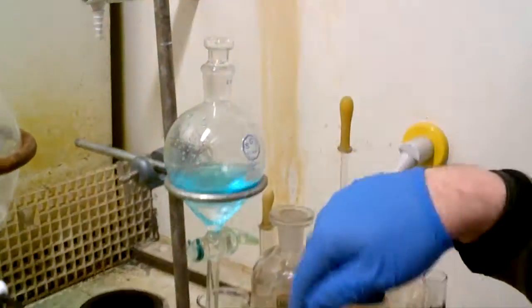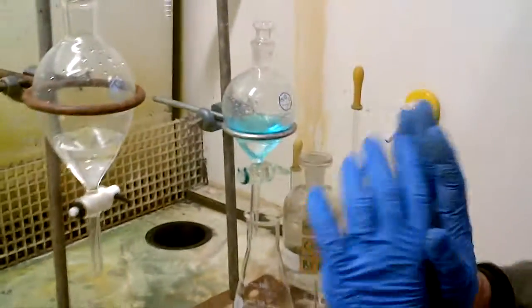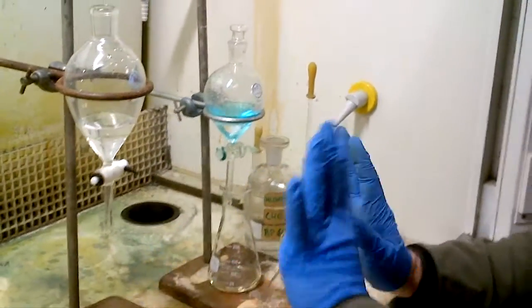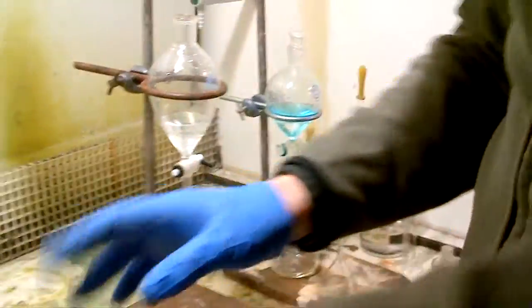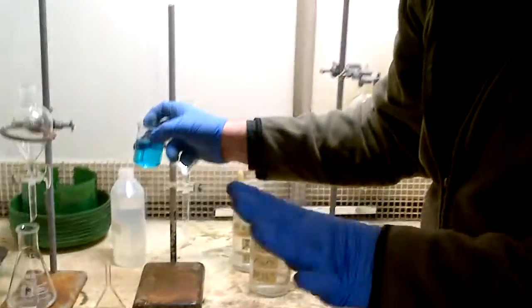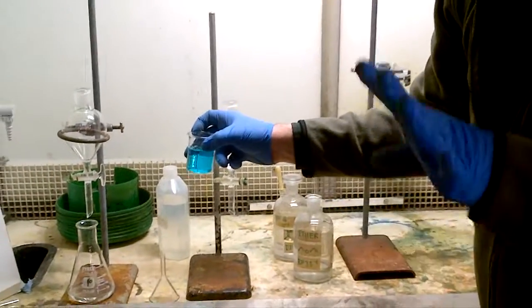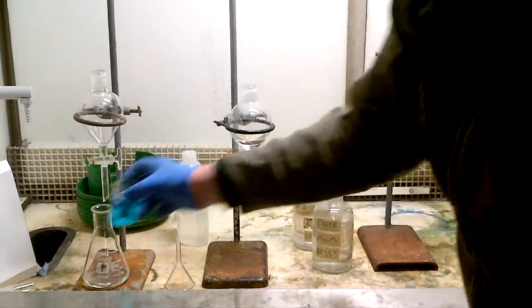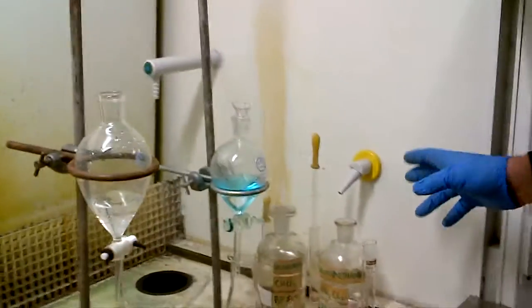And you can feed the DCM into here, when you're doing any reaction, DCM, chloroform, ethyl acetate, ether, never throw away the aqueous phase until you're entirely happy you've recovered the product, right at the end of the product, keep aqueous phases, so keep it at that point, keep the aqueous phase and put it into a beaker, don't throw it away.